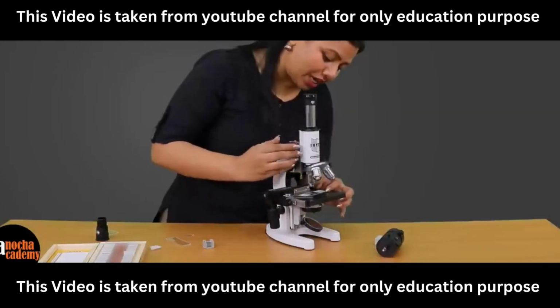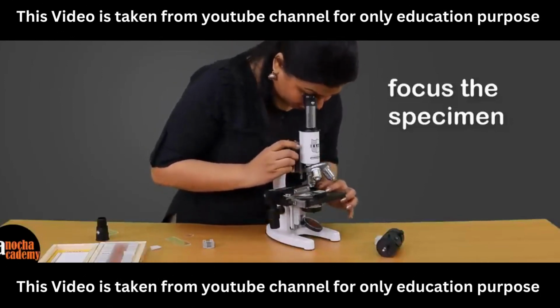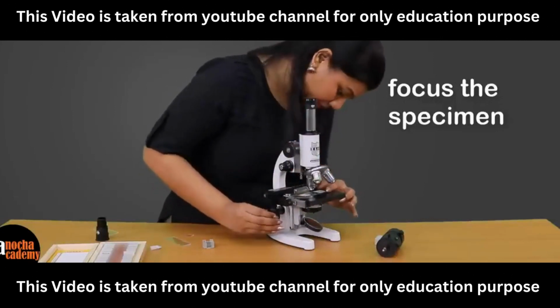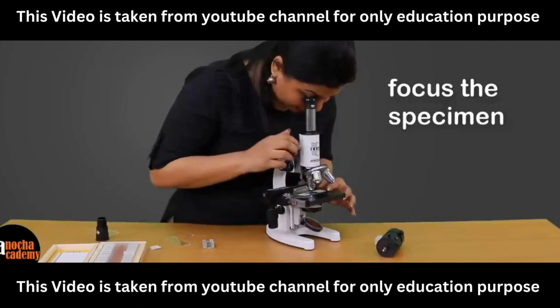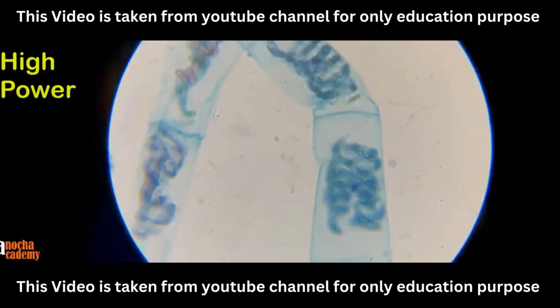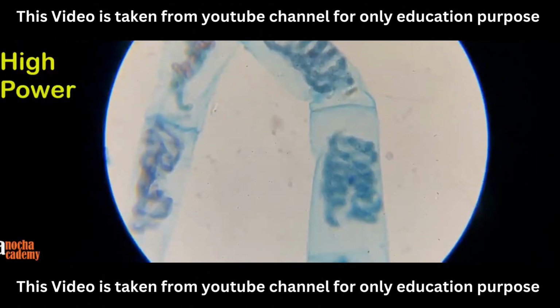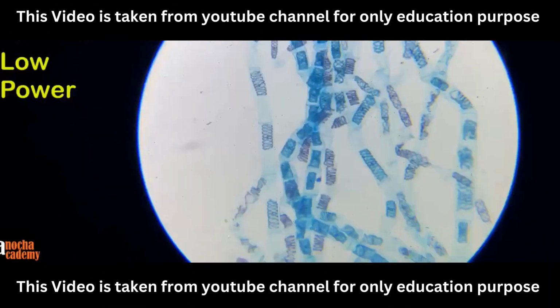Then you start adjusting your focus by moving the coarse adjustment screw. While you are doing that, you can move your slide right or left so that you can bring the specimen right beneath the objective lens. And now I can see a very distinct view of the algae Spirogyra under my microscope. So this is how the specimen looks under the microscope in high power and in low power.